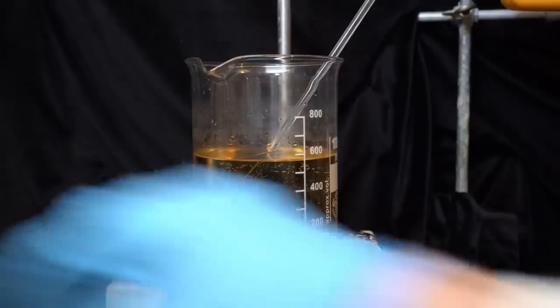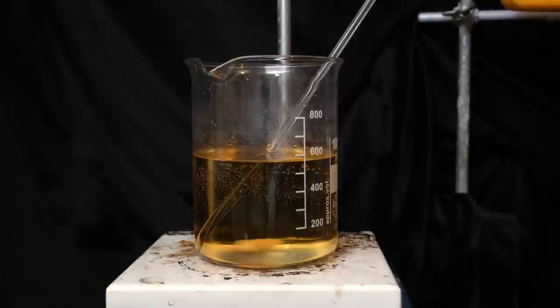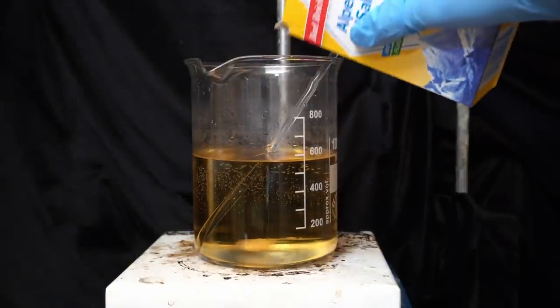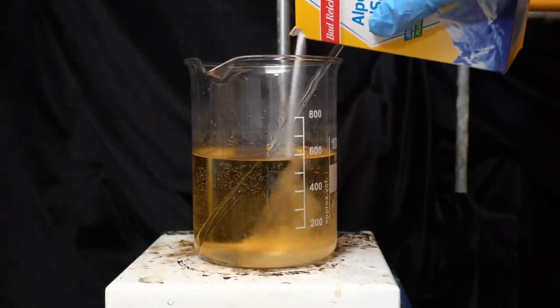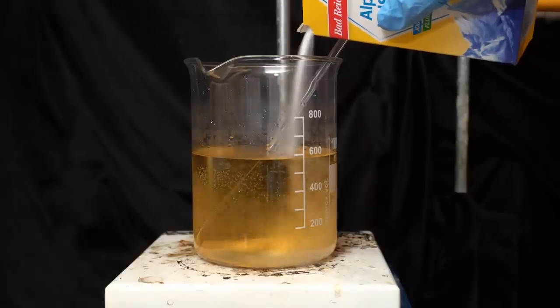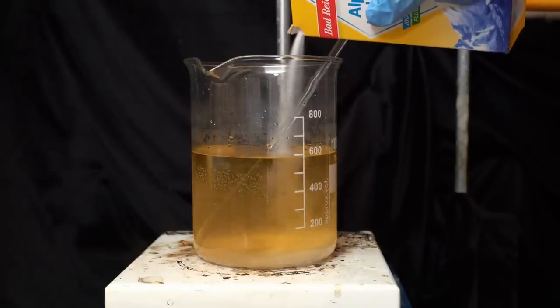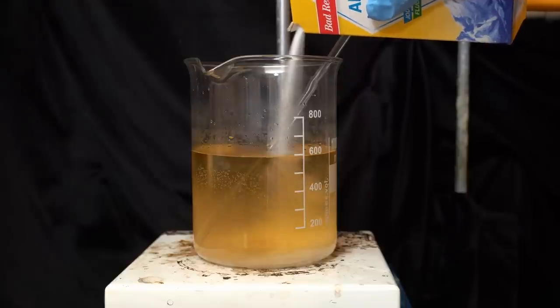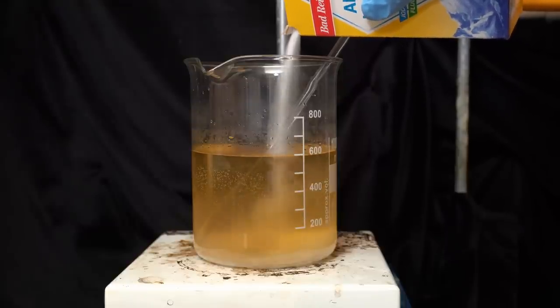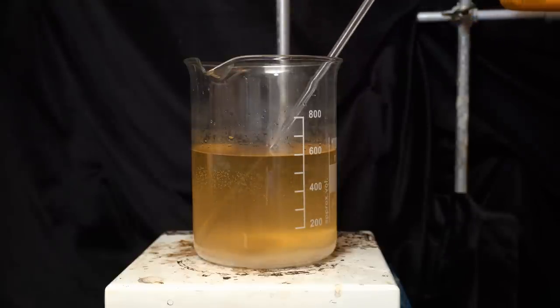So I additionally salted out the aqueous phase and extracted again. I really should have done that in the first run, but I didn't because I am stupid. So now you get to enjoy this montage of me doing the exact same thing all over again.